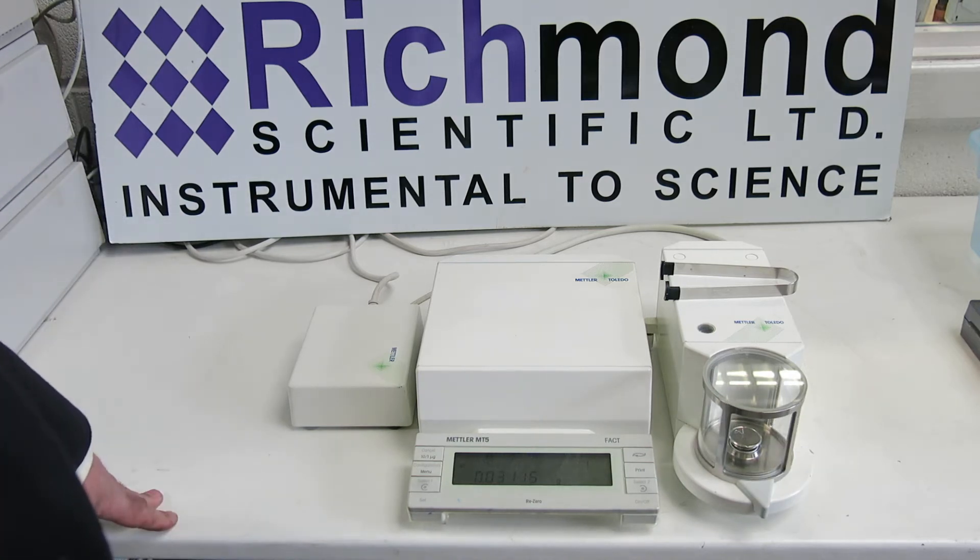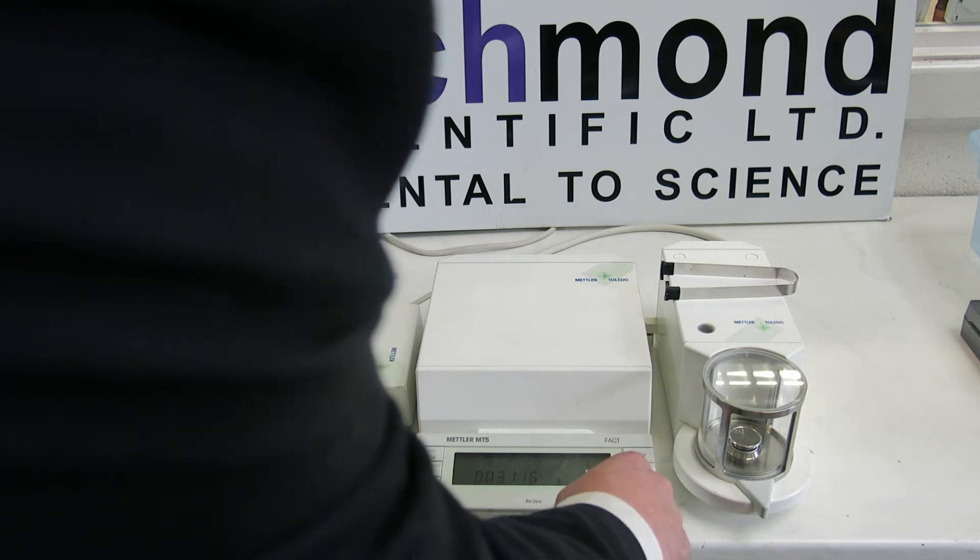So we've got 3115. We'll now open it back up — 3116.